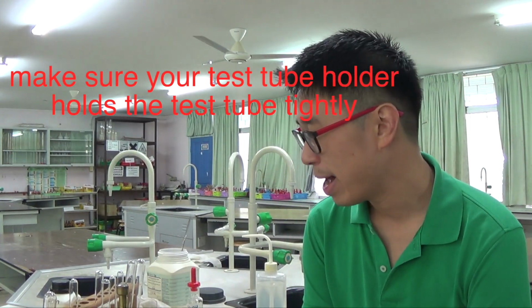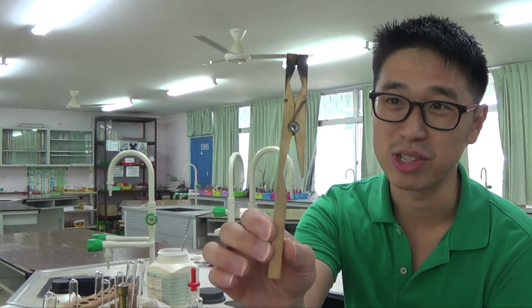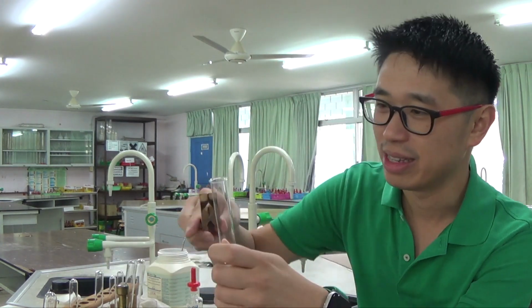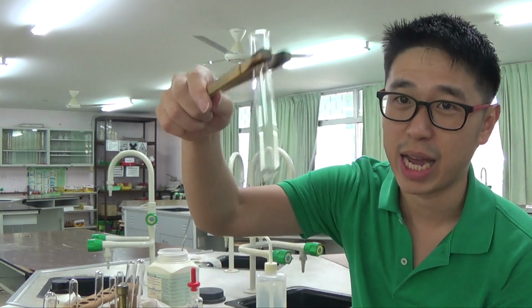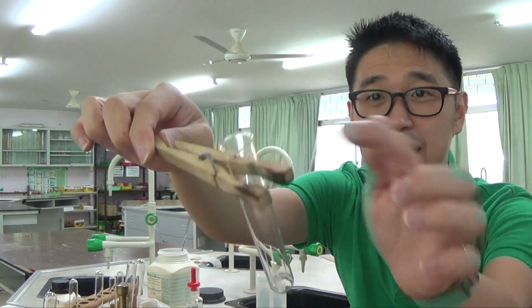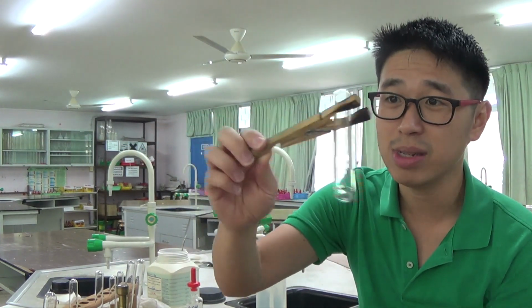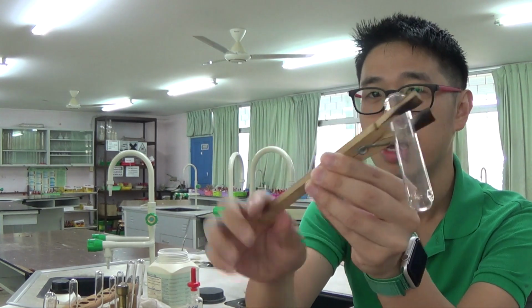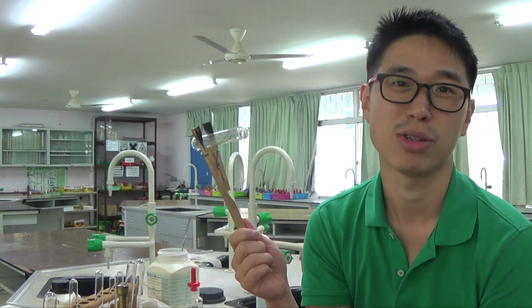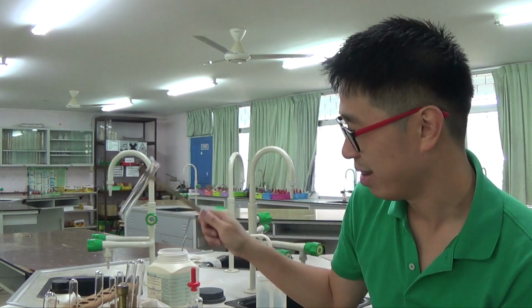And I'm back. So accidents happen, and one of the things that is very dangerous is making sure that your test tube holders are actually strong enough to support and hold your test tube tightly. The one that I had, I should have been more careful, because it was pretty loose around the end. Whenever you hold it, you have to tighten it, so it's not very stable. This wooden test tube holder is a very stable one and a really good one. So it was my bad. I should have checked it, and next time you should check yours as well before you start holding up your test tubes and doing heating and a bit of dangerous stuff.